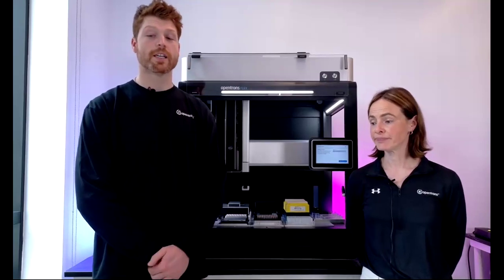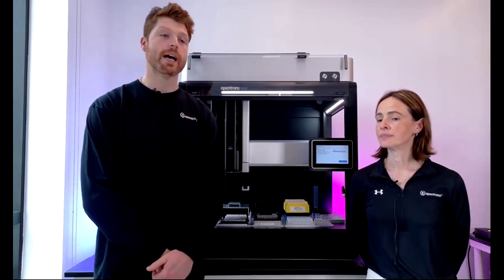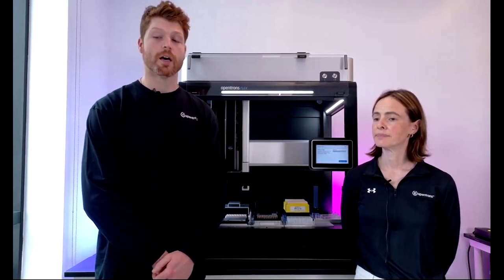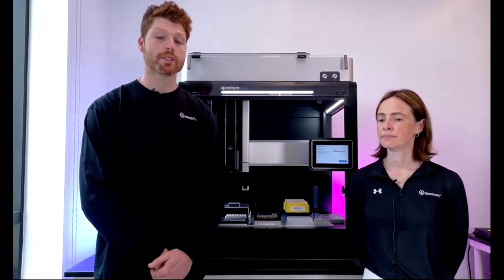Great. Okay. Where do you download the Opentrons software, and what is your suggestion for first-time users on how to start a protocol? Yeah, so in that same protocol library, if I continue to scroll down, there's a link out to the app, and you can download it directly from our website. It's a great area to start to understand what a protocol looks like.